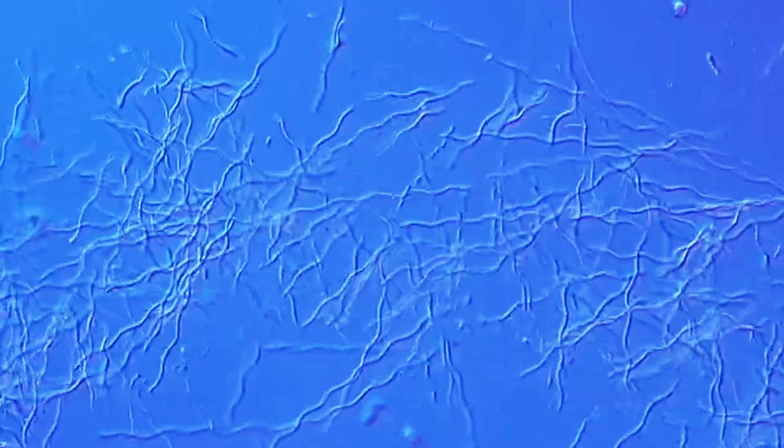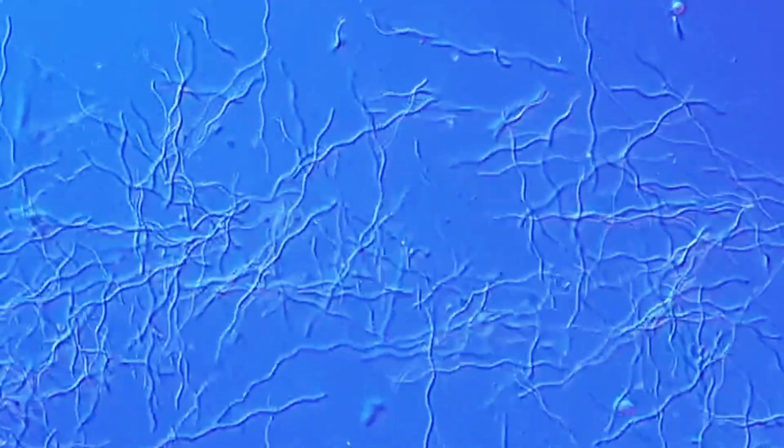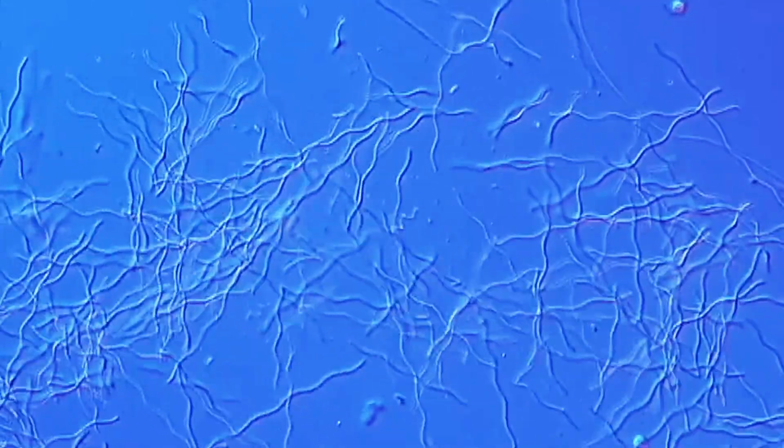So I decided, great, those spiral-shaped bacteria, because they move so quickly and rapidly, you would be able to see the effect of a disinfectant quite well. Do they stop moving? Do they run away from the disinfectant? How fast do they stop moving? How fast do they die? Well, a lot of questions that we can answer, and this is essentially what I've tried to do.